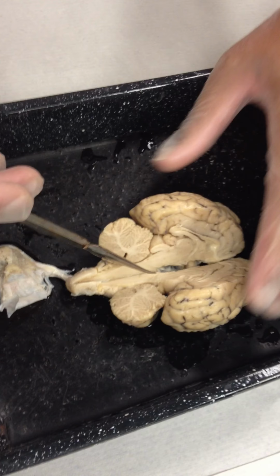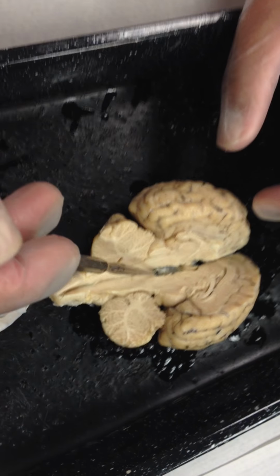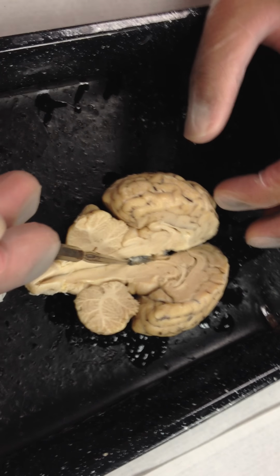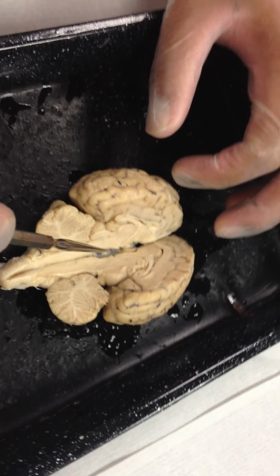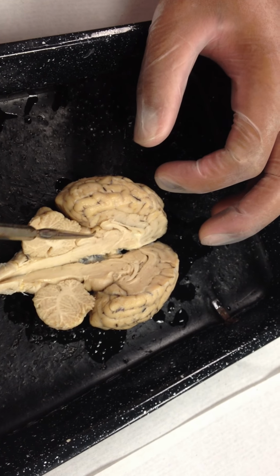We can compare that location to this inside location for the pineal body. That's the pineal body right there. The pineal body is quite a bit larger in a sheep than it is in a human relative to the proportional size of the brain. This next one is this other round structure right here. This is one half of it. We sliced through it by making a sagittal section.